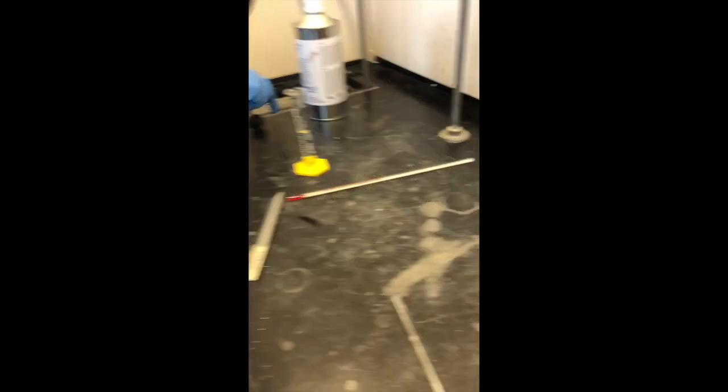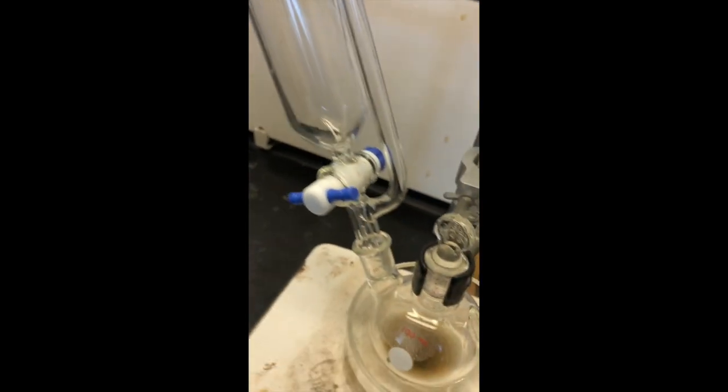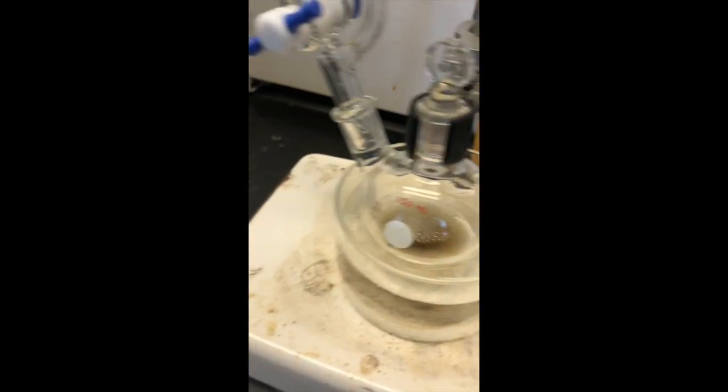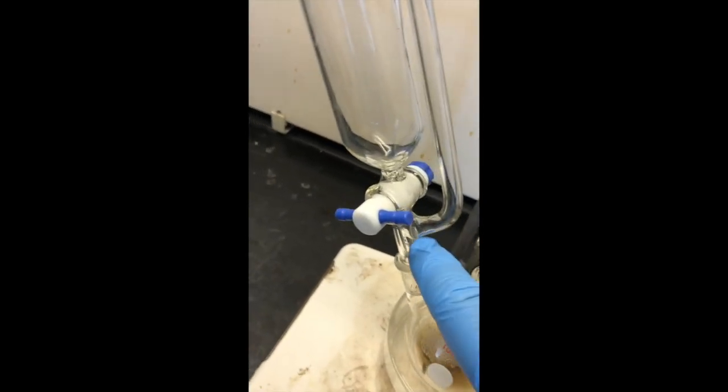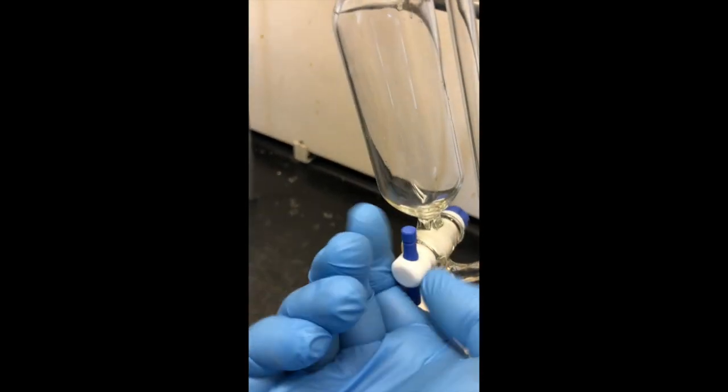And that is going to eventually go into this addition funnel. During the reflux period, we noticed that the addition funnel started to have some ether vapor travel up the arm and condense back in there. So we've added that back in.